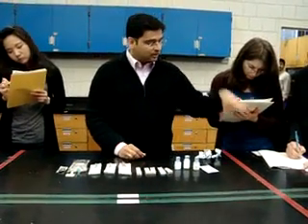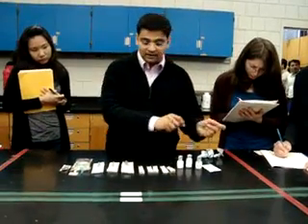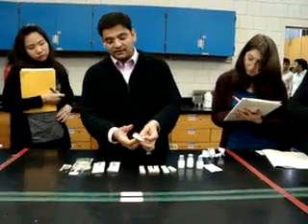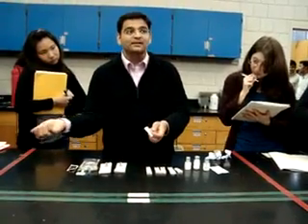At this point you have your procedure sheet right here, so you don't have to use your brain — it's all written there. Now you open the syringe. Since I folded the syringe, it is so easy to open. Otherwise I would be fumbling and my 2 minutes would be gone.